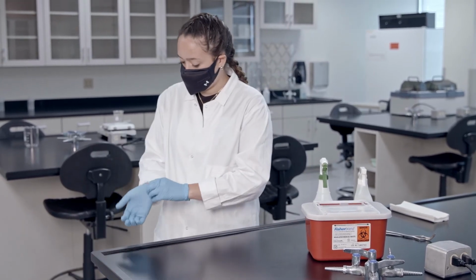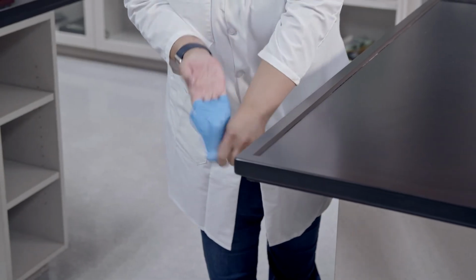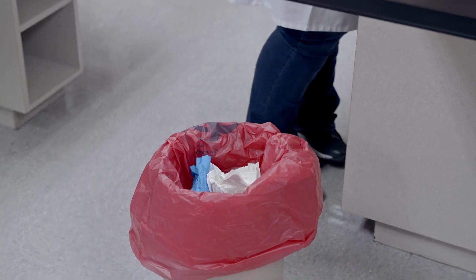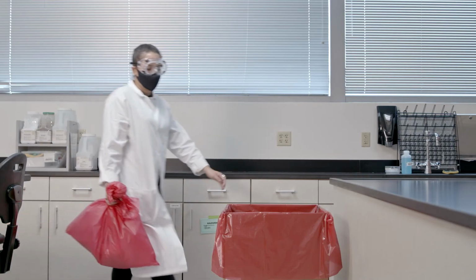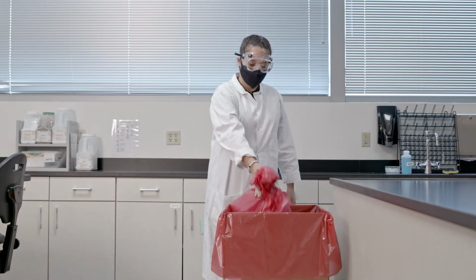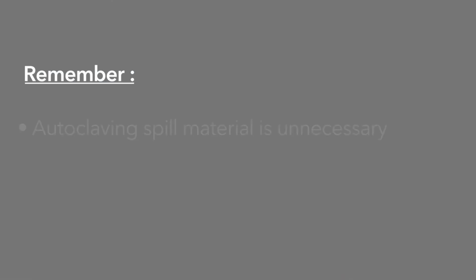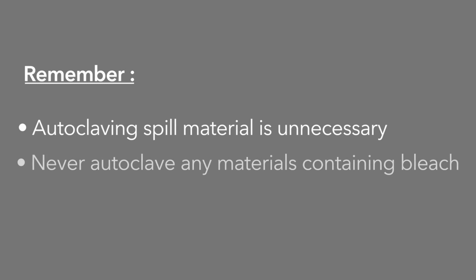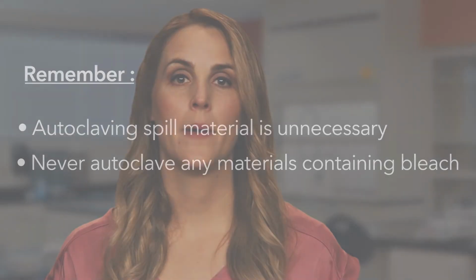Discard all disposable materials used to decontaminate the spill and any contaminated personal protective equipment into a biohazard bag. Seal the biohazard bag and place in a biohazard box for disposal. It is not necessary to autoclave your spill cleanup materials, and remember, you should never autoclave any materials that contain bleach. Remember, only clean up a blood spill if you are trained and feel comfortable to do so.